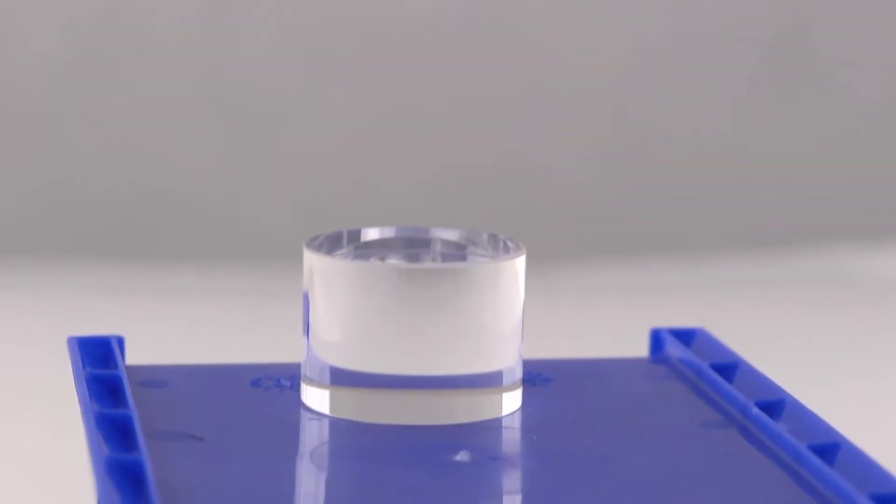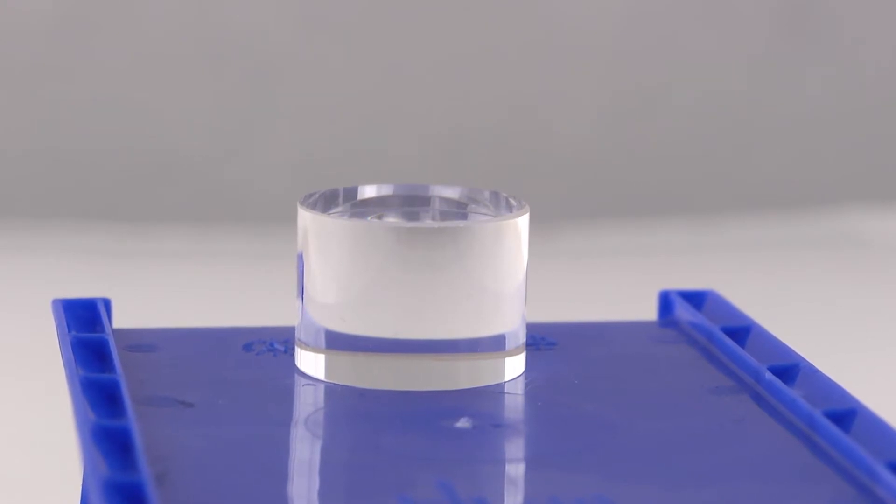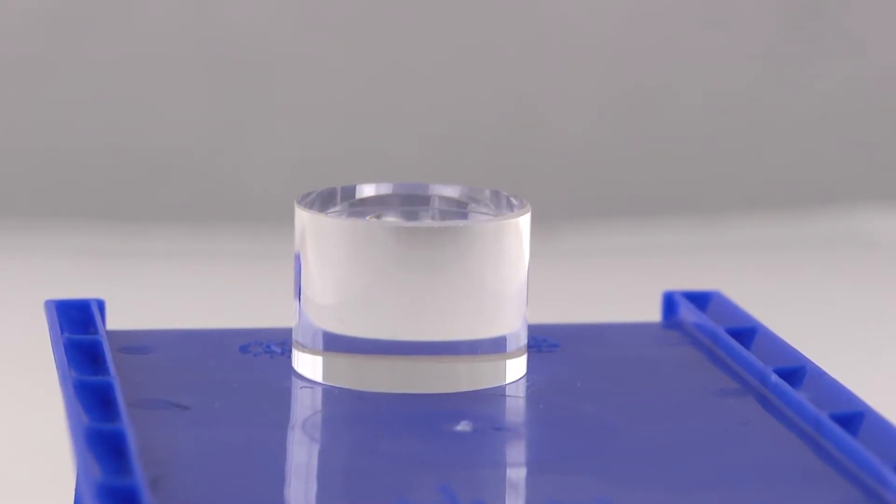It boils down to essentially three aspects: contamination, accuracy, and repeatability. The XRF contamination check is where we use a blank sample to test the cleanliness of the front of the analyzer — the window. It also allows us to check if there's any dust affecting the results. We supply a silicon dioxide fused quartz disk with every analyzer, and when measuring that, we should only measure silicon. The user should insert this blank at regular intervals during their batch testing.